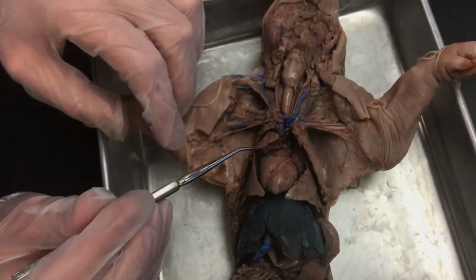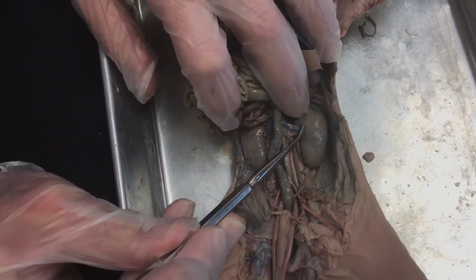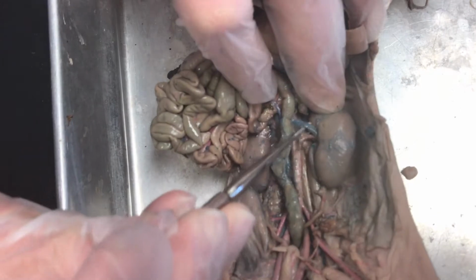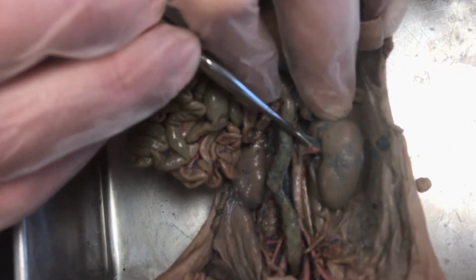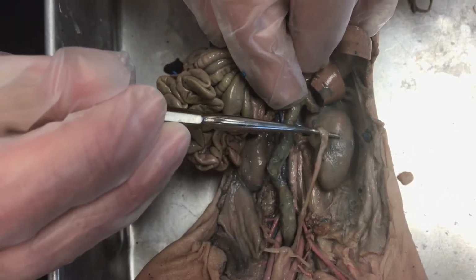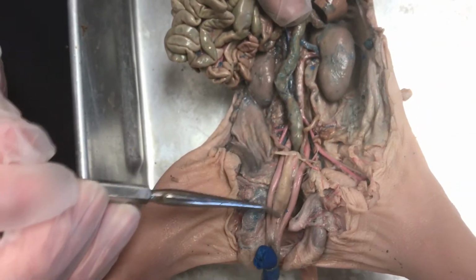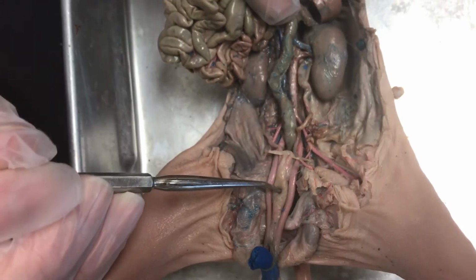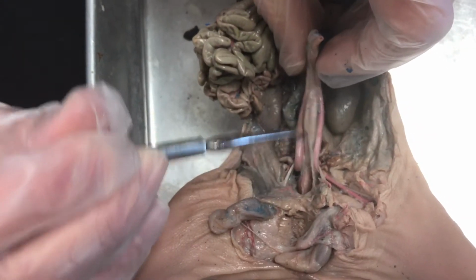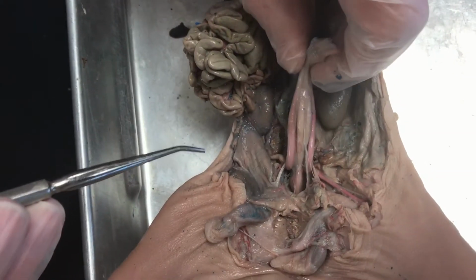Let's go down here. If we pull the intestines back, we see the kidneys here on either side. And you can see some blood vessels. You've got the renal vein in blue and the renal artery in red going into the kidney. And then coming out of the kidney is this tube, which is the ureter. And then that tube leads to this structure. It's actually kind of embedded in the umbilical cord a little bit. That is the bladder. And then the urethra is the tube from the bladder out to the exterior of the body, and that kind of goes down into the pelvic area there.